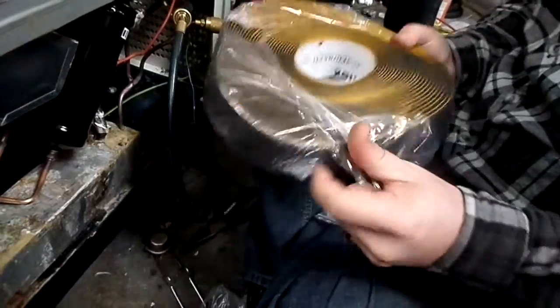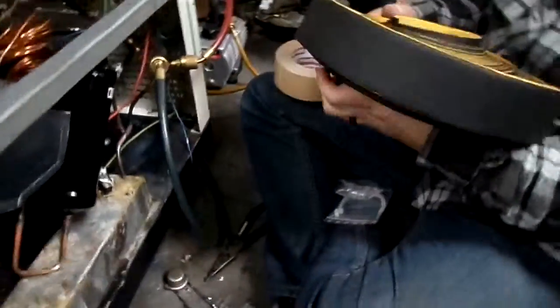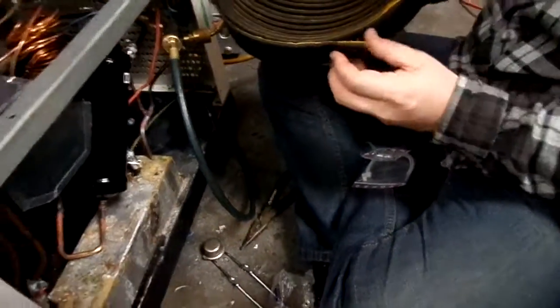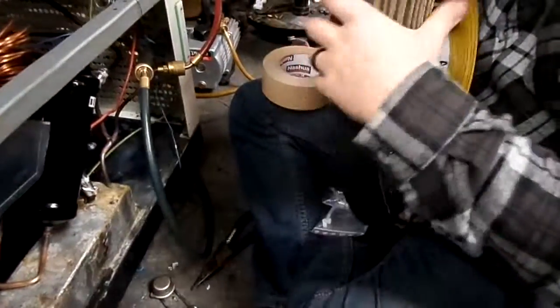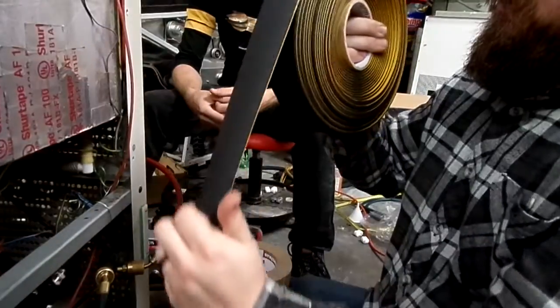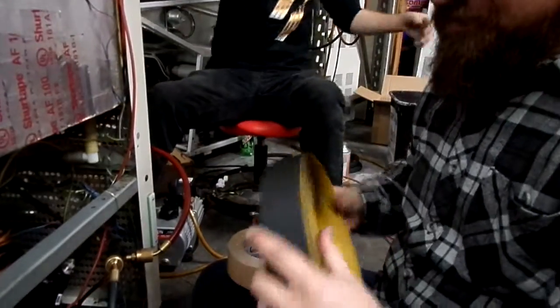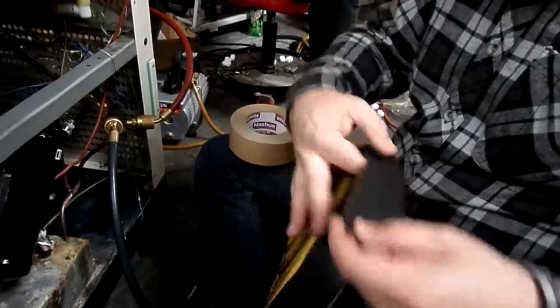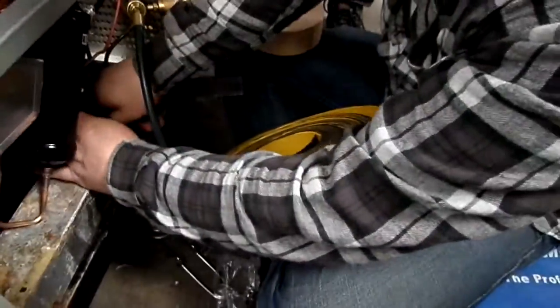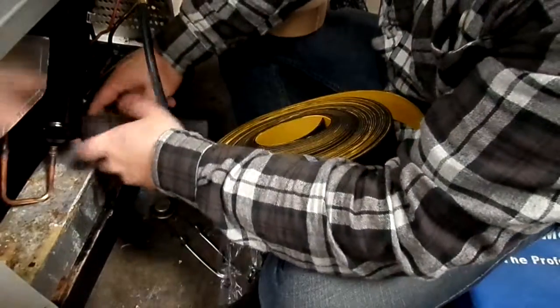This part should be, oh hello. This part should be pretty self-explanatory. Take this guy up. And then you just take a decent strip, obviously. You're gonna wrap it up. Any part of the return line, you're gonna wrap it. Any part that was wrapped up as you were taking it apart, wrap it back up.